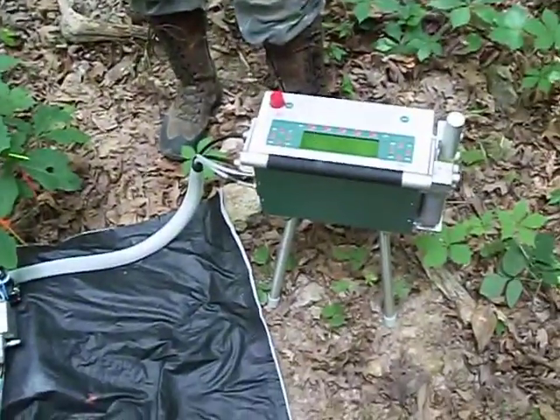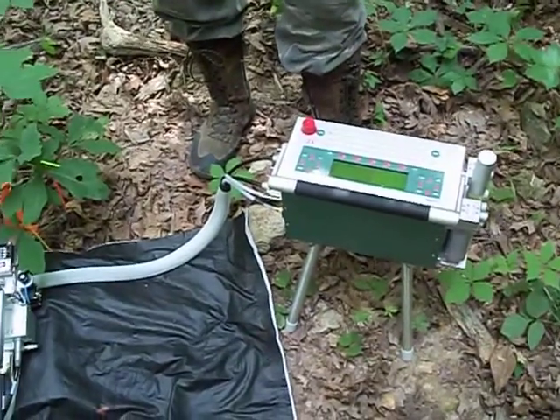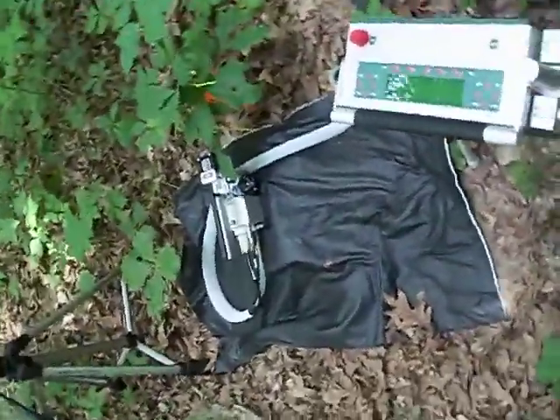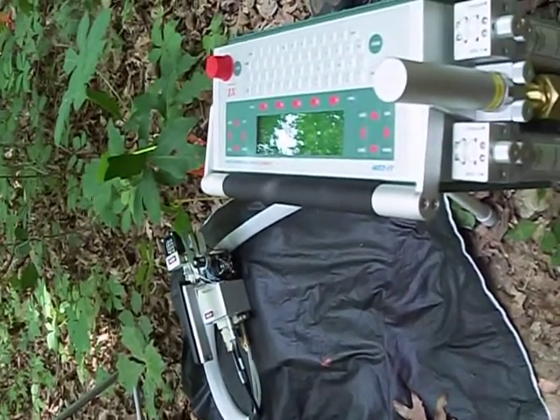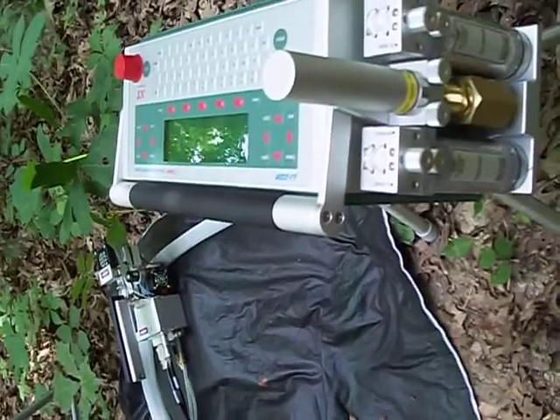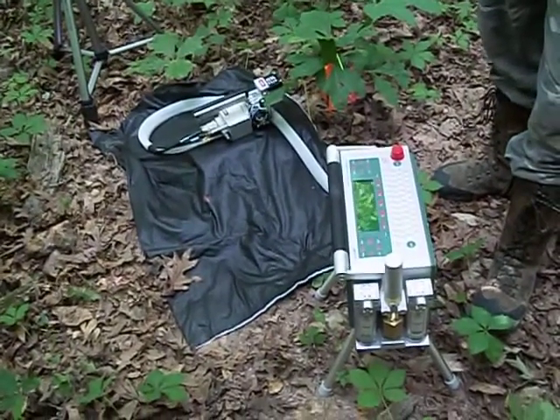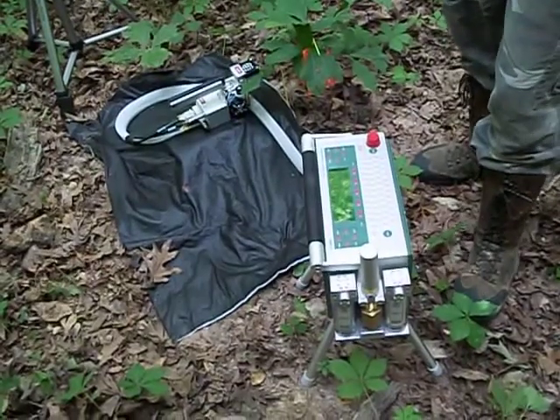This is a CO2 gas exchange instrument, and it basically measures the exchange of CO2 between the air and the leaf. Since leaves fixate carbon for food, when you measure the amount of CO2 that is taken out of the atmosphere, you can use a set of formulas and calculate the photosynthetic rate and all sorts of other variables.